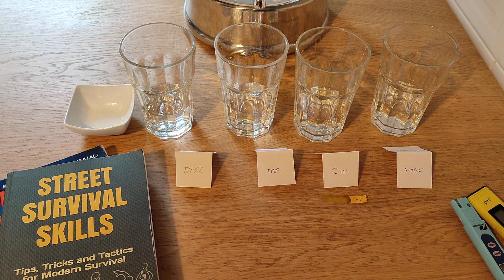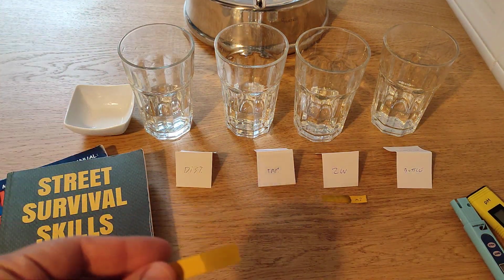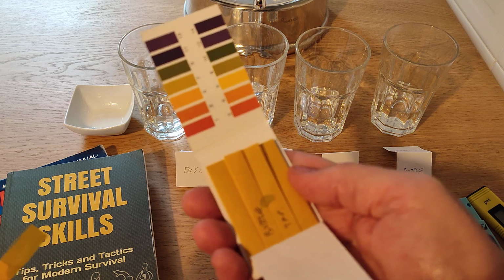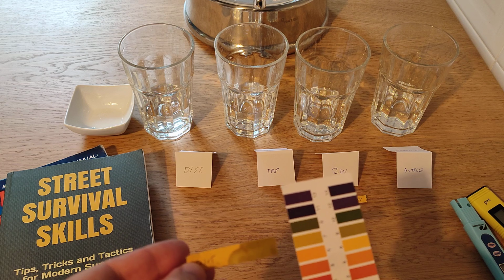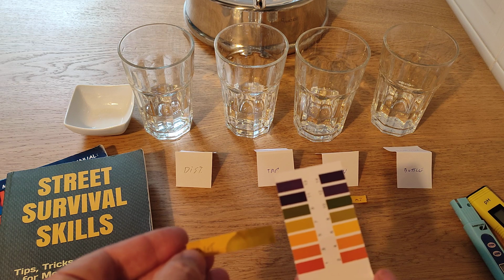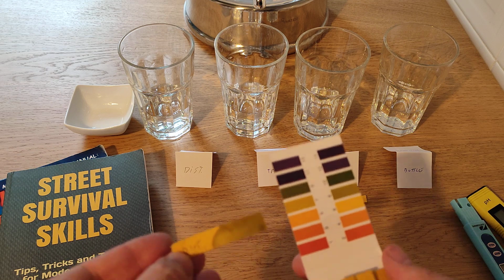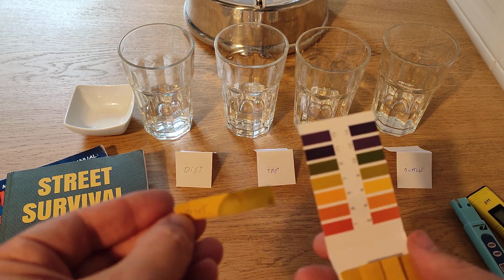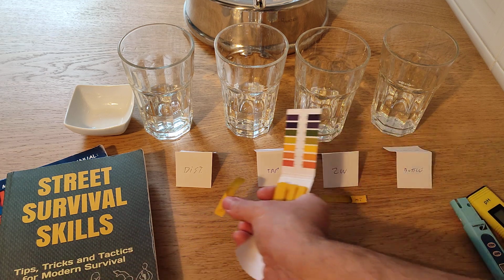Let's go now with the distilled water, all right? Distilled water. Okay, little one. There we go. And yeah, I have a big old spot there from all these things. Distilled water, again, is gonna be a 7. I think it's close to 7, even though the meter gave me like 6 and something. So there is a margin of error here, but I will say that distilled water is a solid 7. Not different from the zero water.